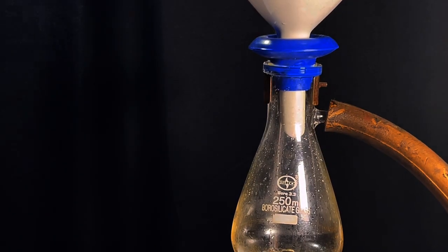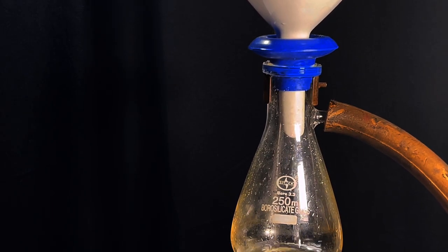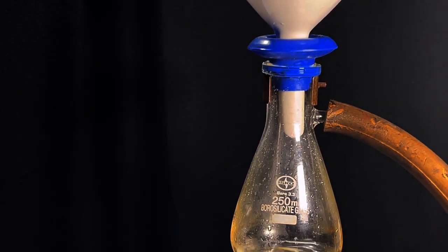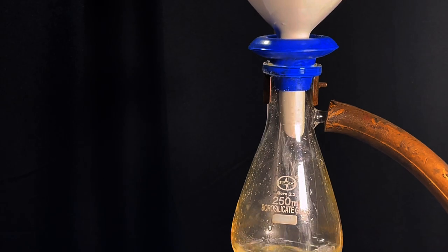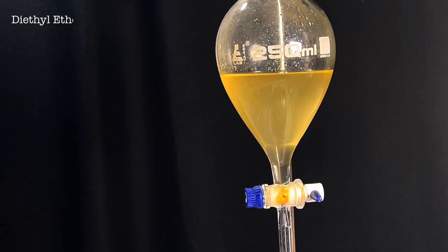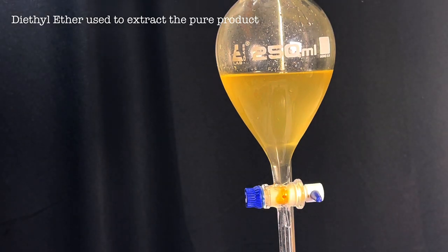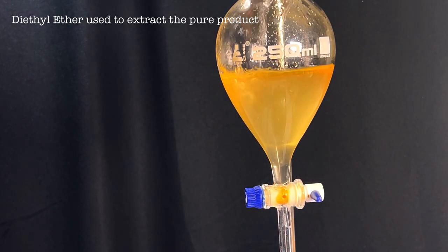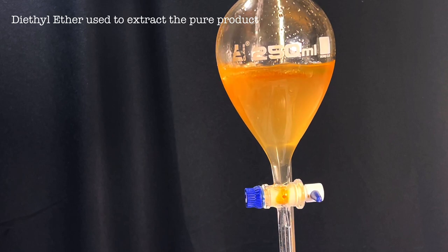The solution was then vacuum filtered to remove the sludge. The clear filtrate was then extracted twice with diethyl ether and the ethereal layer was subjected to distillation.